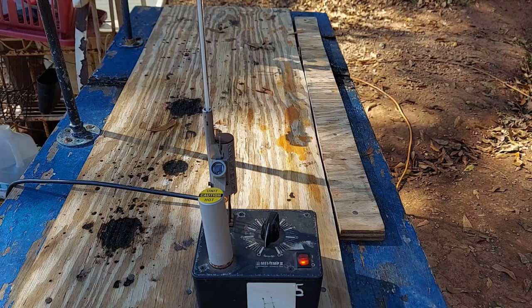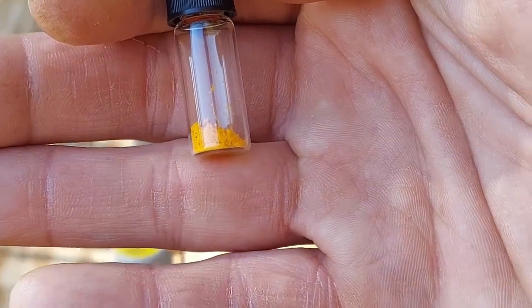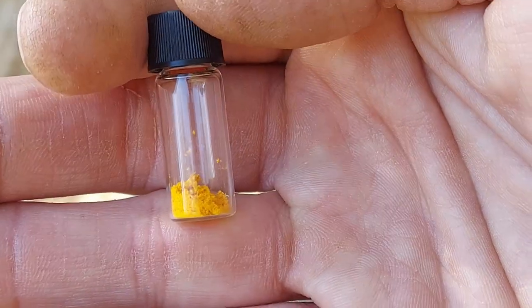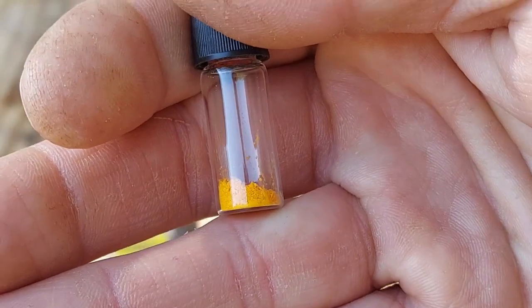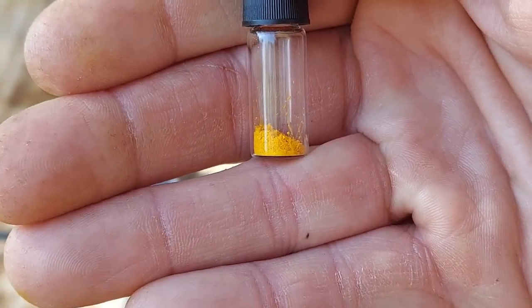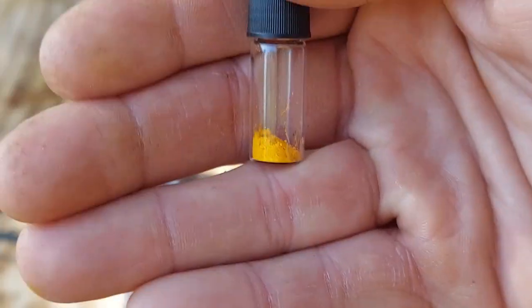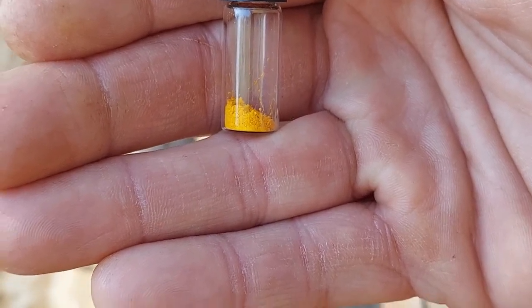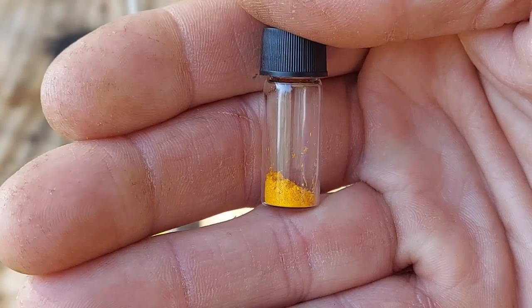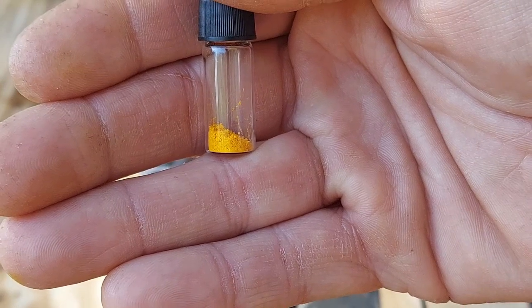Anyway, I have plenty of the experimental dinitrophenylhydrazone. This is what I was able to obtain — very nice — in a two-milliliter chromatography vial. And by the way, to the person who suggested holding your hand up in front of whatever you want to focus on to solve the focusing problem — you are a god or goddess amongst men. Thank you so much. I don't know how I never thought to try this trick before.